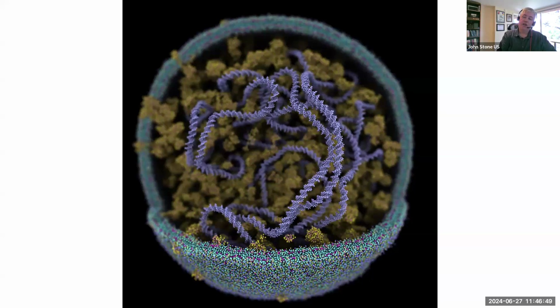And by the way, if you get into this regime where you're doing stuff with cells, there are some ways to compile VMD to use less memory even than the normal version. When we're doing all atom simulations, there are a bunch of heuristics that VMD uses to provide very high performance, and with those heuristics we spend some memory to make things faster.